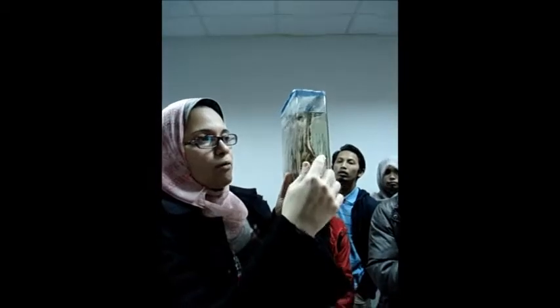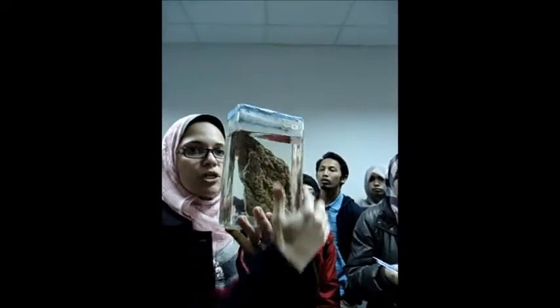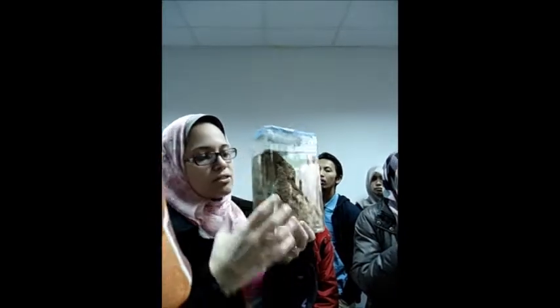All right, so that's my benign tumor, and that's my other one. Let's have a look at these malignant tumors. Let's start with this one. Okay, this is a piece of skin, and what I see here is an ulcer, a huge ulcer. When we describe an ulcer, there are several entities that I have to comment on. First of all, the number. When there is only one, this is more with malignant. When they are multiple, it's more that it is an inflammatory condition. So here it is a solitary ulcer.